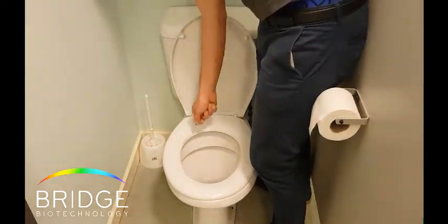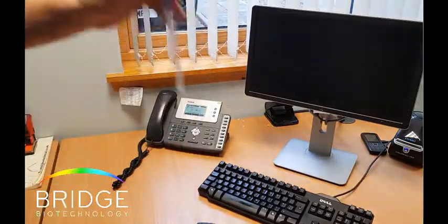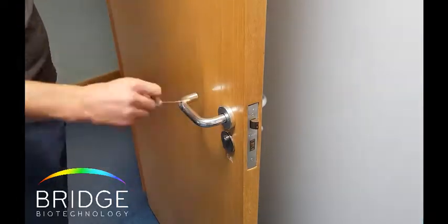Before we started testing the keyboards we thought we'd test a few other things around the office. So we looked at a toilet seat, a landline telephone and a door handle. After we had tested the toilet seat, the door handle and the landline, we gathered together six volunteers and swabbed their keyboards to measure the bacteria, and compared these readings to the earlier objects.